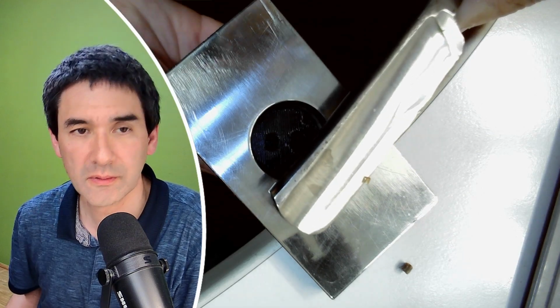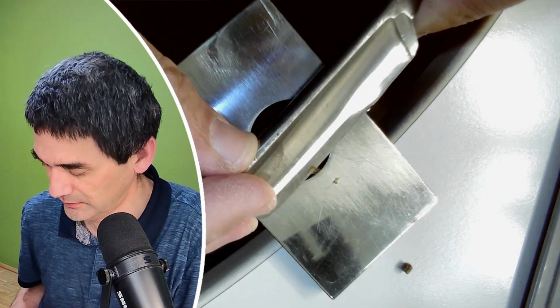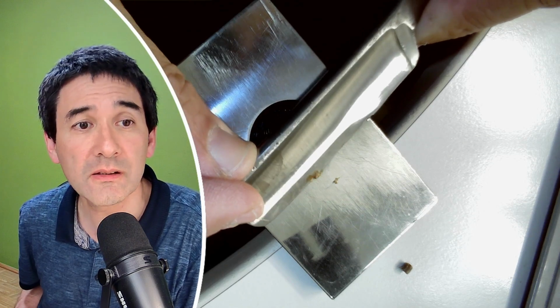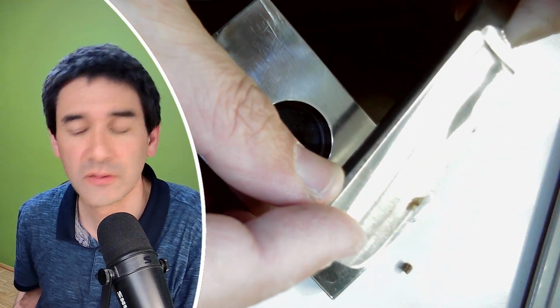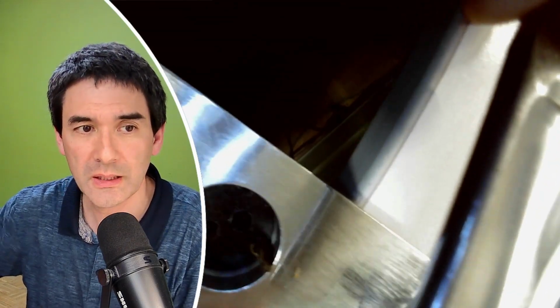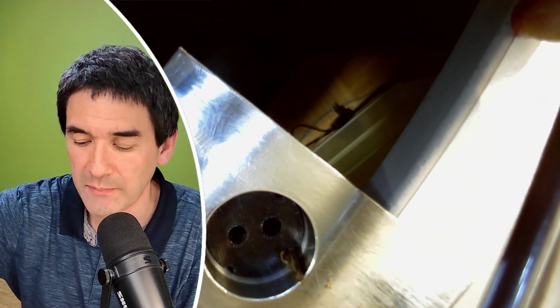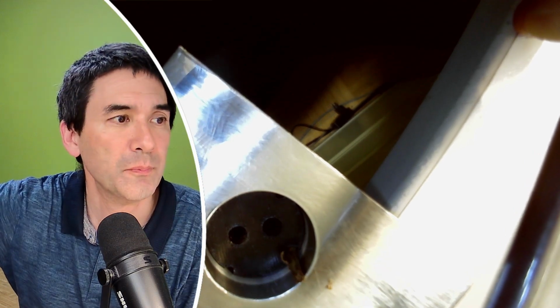Let's see. No, it rips it more than it actually cuts. Yeah. So I'm going to do the following now. I'm going to put it up. I bumped into it. I'm going to put it now on a microscope slide. And then let's have a look at it under the microscope.